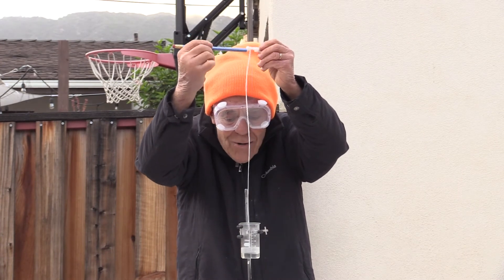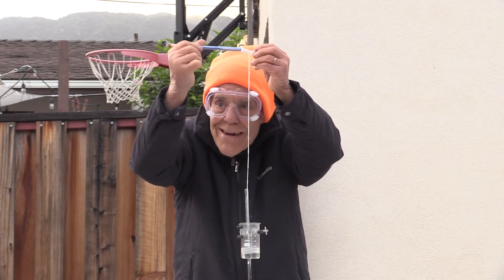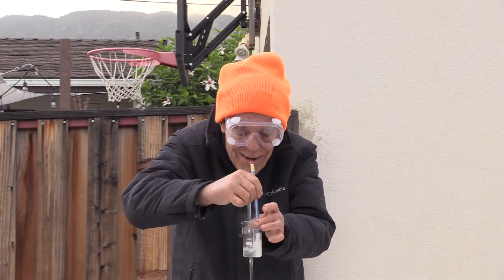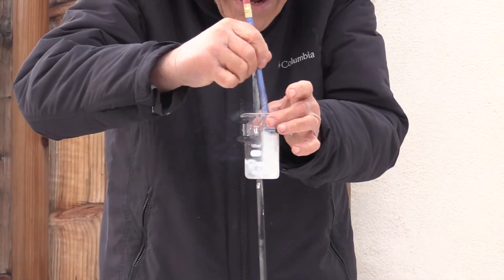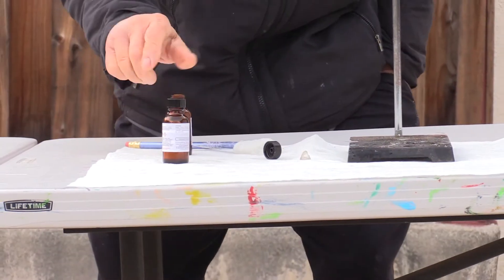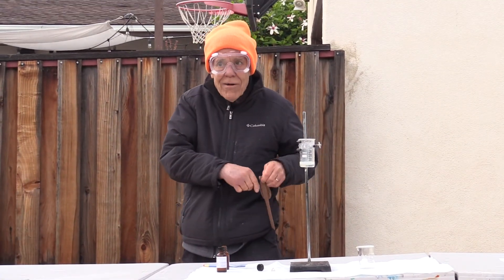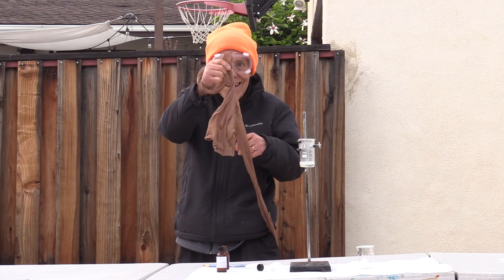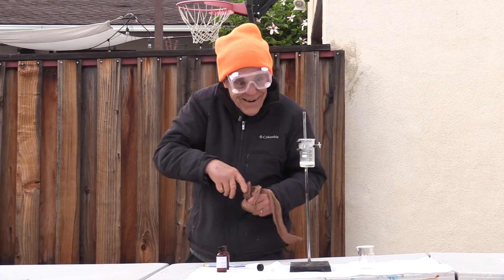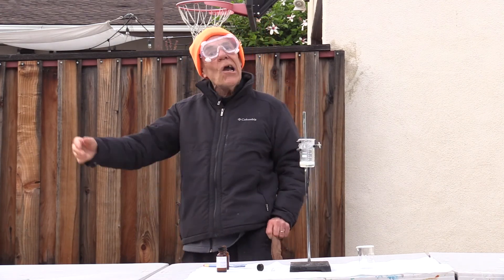Now, why don't I stop this, and if you don't mind, Dr. Byrd, I will mix this up now that we've made a bunch of nylon. Go for it — let's make the nylon ball. Let me pull out the nylon ball. Look at that blob of nylon! I spilled some of this solution that went into my pocket, Miss Videographer. Look what comes out of my pocket — a nylon stocking! What the heck happened? Amazing. Chemistry magic for today's wonderful world. Another example of Backyard Chemistry!